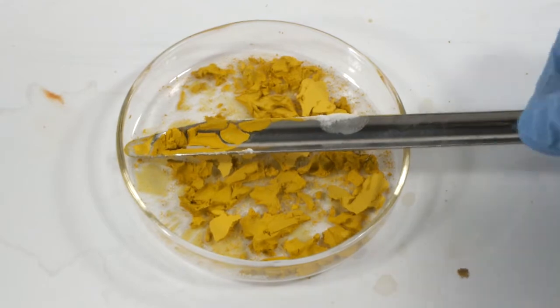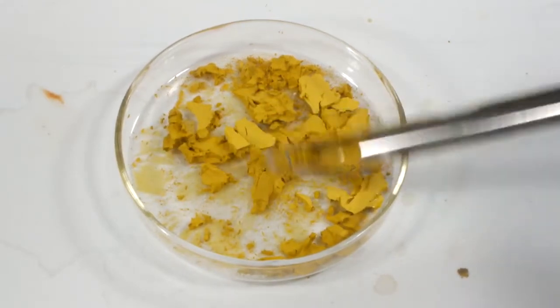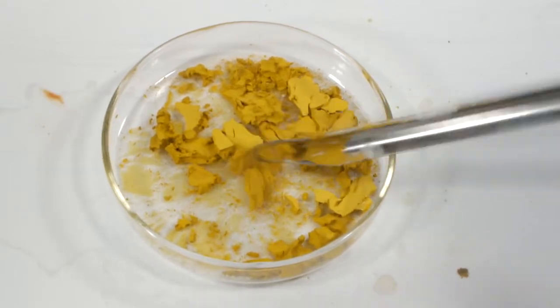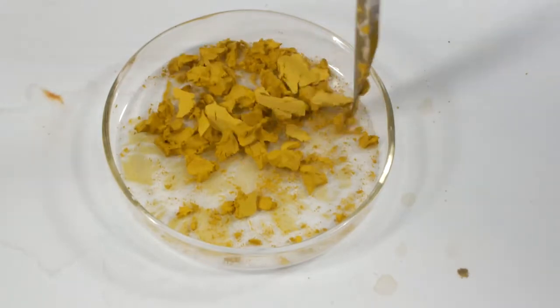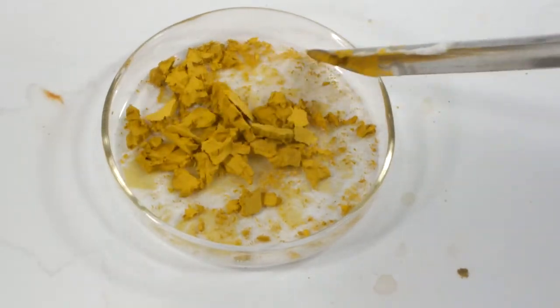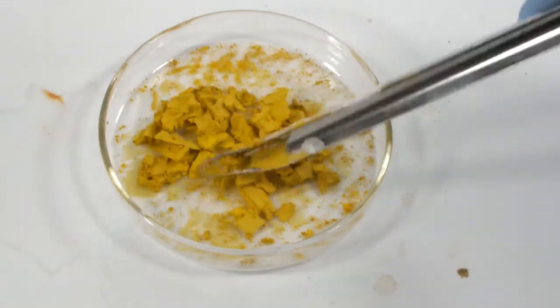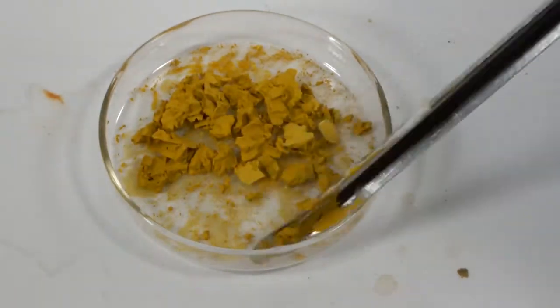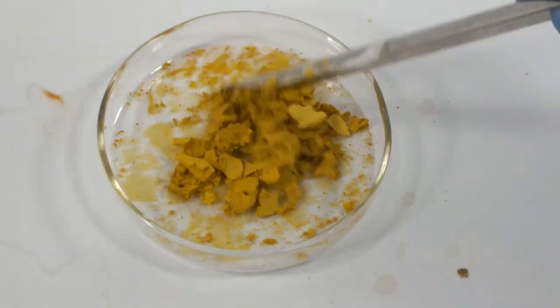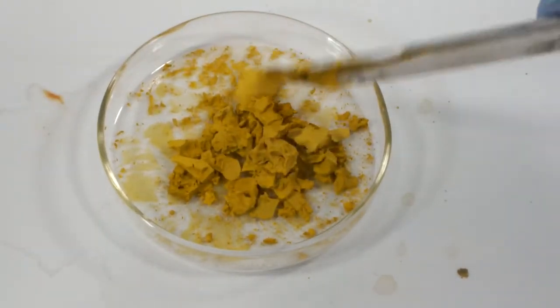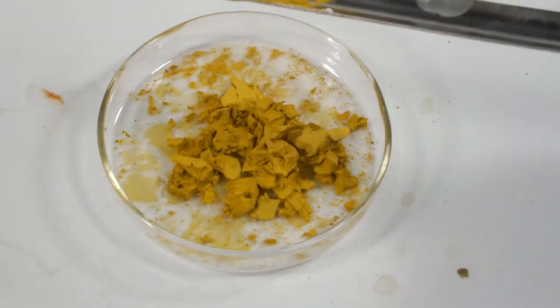This was a little less cooperative in the drying process, and I'm left with these chunks. Lead chromate is used as the main pigment in yellow pavement markings, and it used to be the primary component of school bus yellow paint. I ended up with 9.3 grams, which is more than I should have. The white junk you can see on the spatula is probably excess lead nitrate, and that biased the yield a bit high. If I ever plan to use this, I'll probably wash it a couple times to get a purer product.